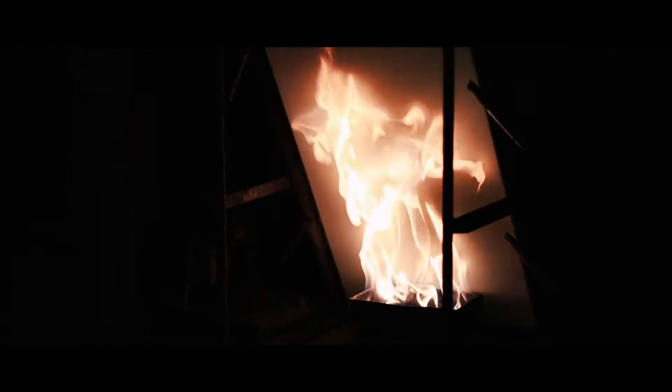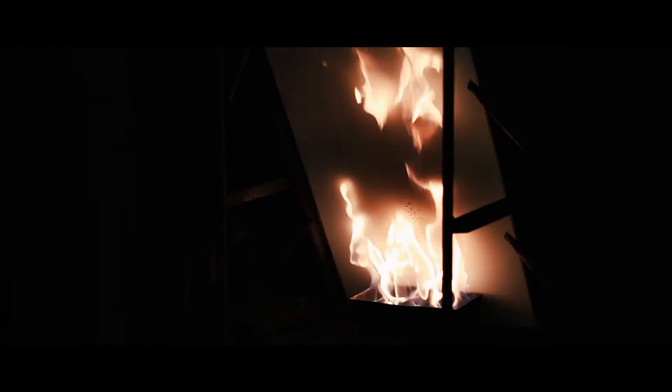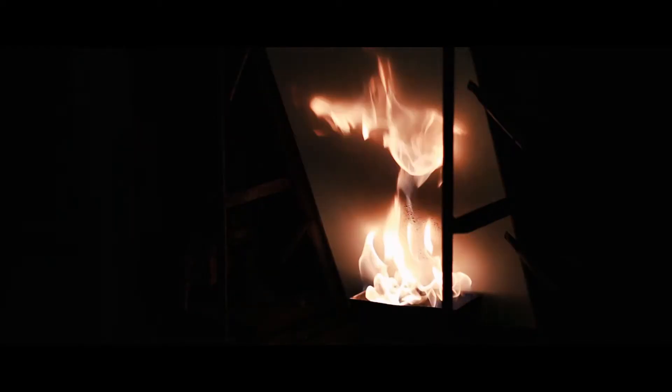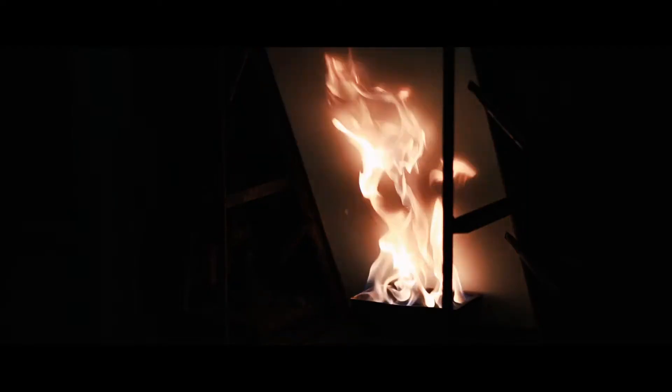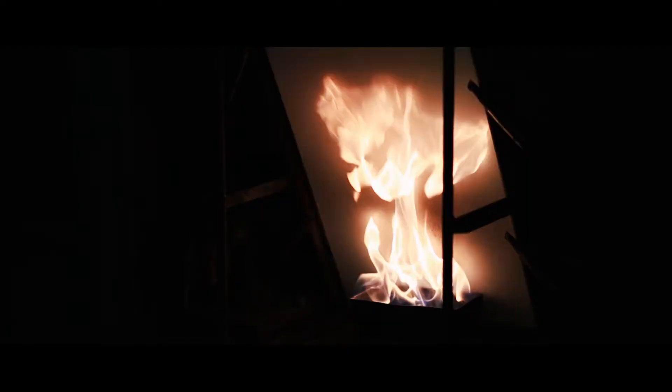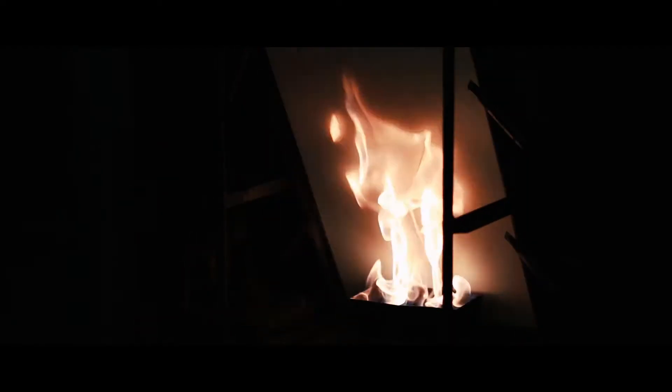The test room door is shut and this means that any smoke produced by the specimen is held within the test room. We have a light system and this is used to measure how dense the smoke is.